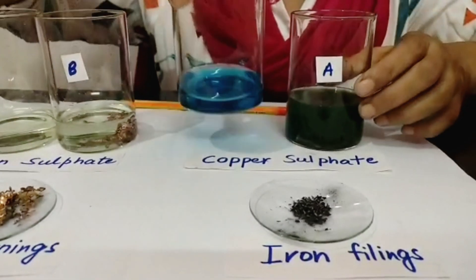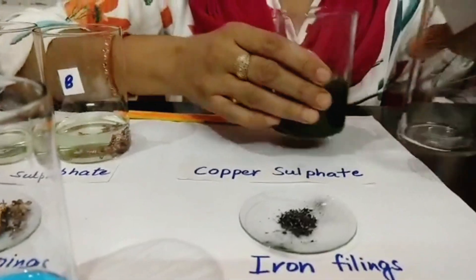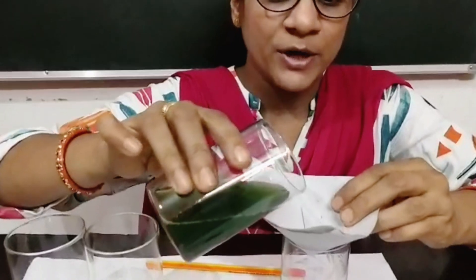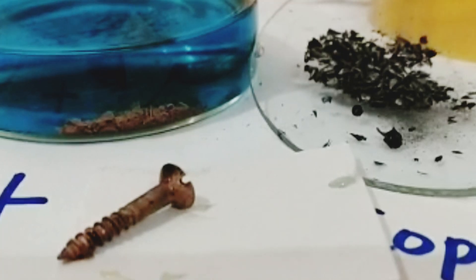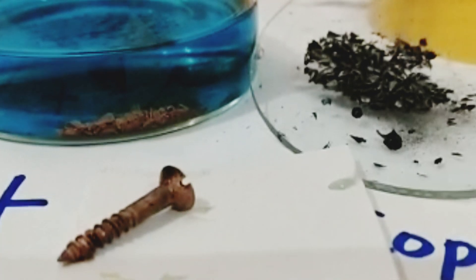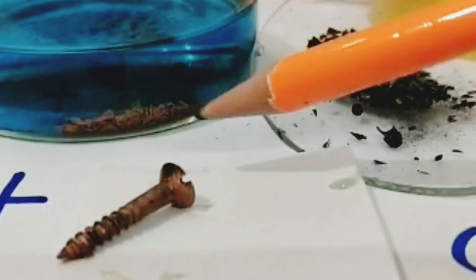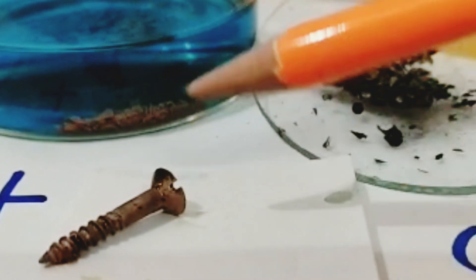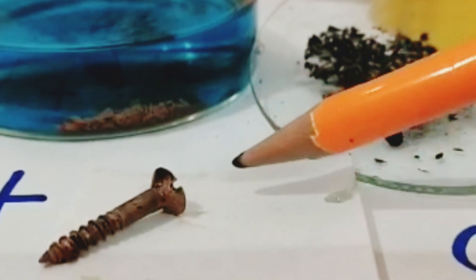Now we will check what happens to the copper — is the copper also formed? For this I have this filter paper and I am going to filter this. Let's observe the formation of copper. When we put the nail in, the nail was completely black in colour, but the copper was formed and copper was deposited over this nail.